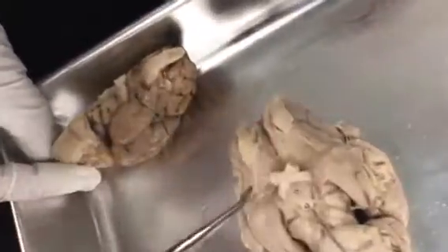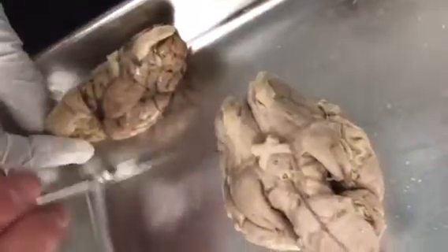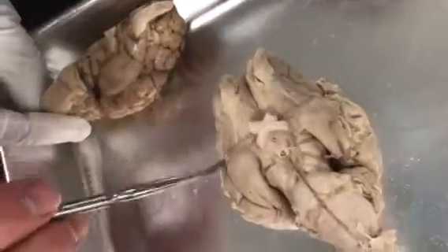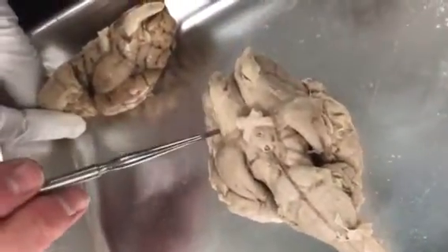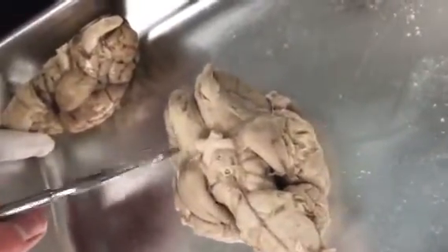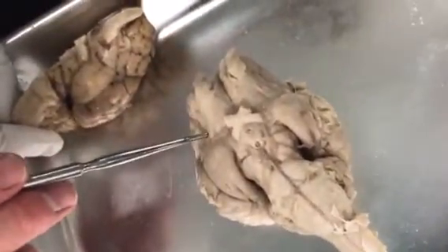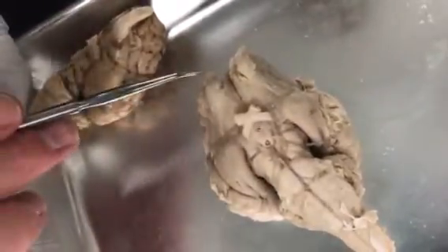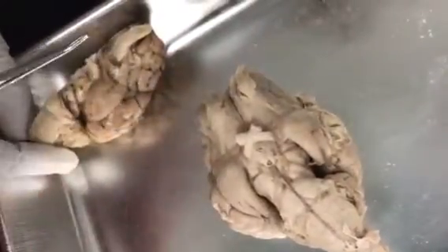It kind of runs down here, kind of like this. It looks like one of these other bumps. What are these bumps called? Gyrus. What are the indentations? Sulcus. So this coming down looks like just another gyrus, but it's not. It is the olfactory tract. Remember, a tract is a bundle of fibers in the central nervous system. Nerve is a bundle of fibers in the peripheral. So what's coming down here into our nasal cavity are the nerves.